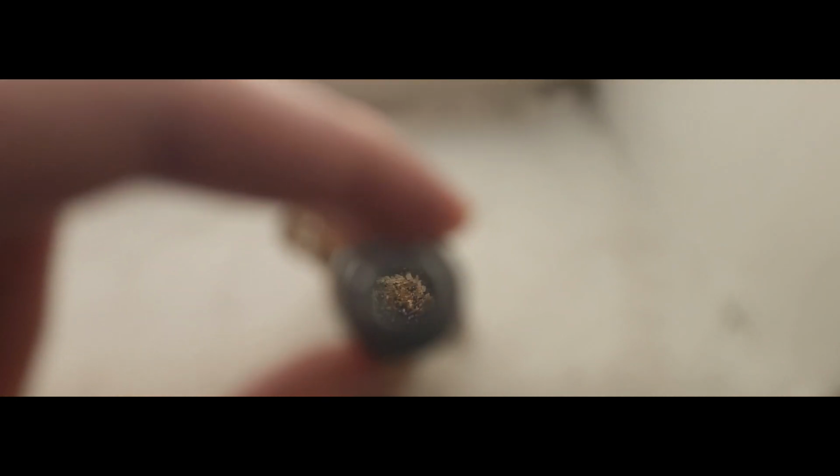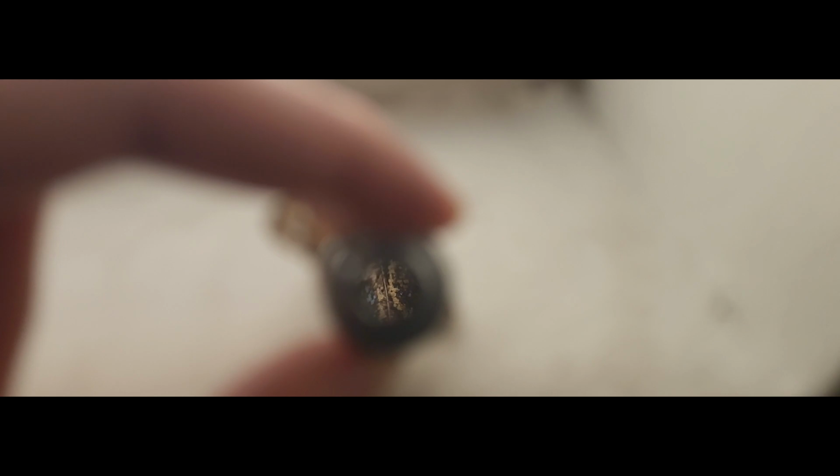Most microscope lenses are removable and they have a thread called RMS. There are RMS adapters for any type of camera mount, and they're super cheap. In general, microscope lenses are easy to adapt for any camera. You can even use them with your smartphone if you can figure out how to attach them.